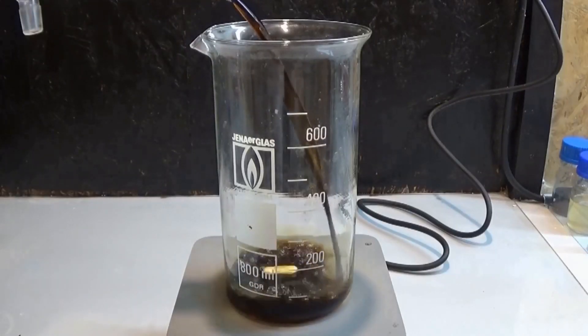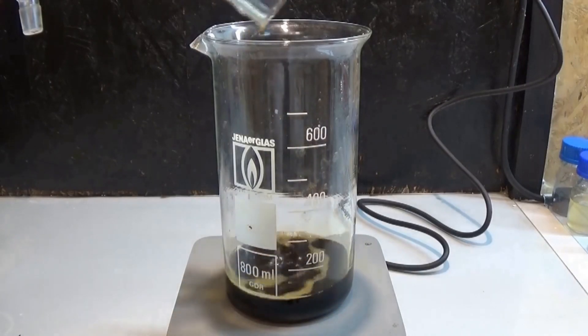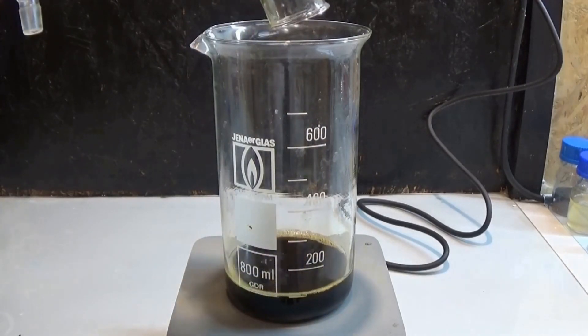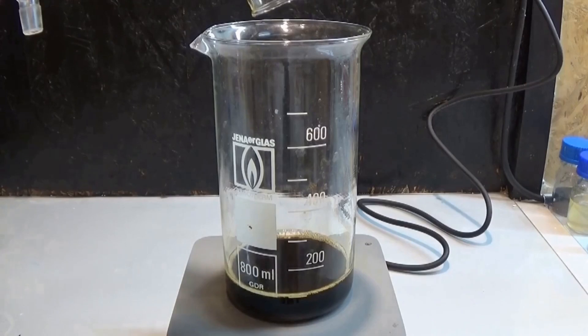Now we are finally approaching the last step: getting our piperine out of that solution. For this, we are utilizing two properties of the involved chemicals, namely solubility and miscibility.